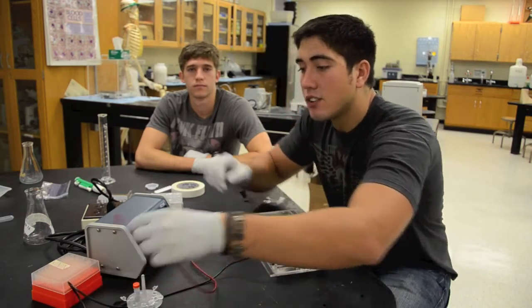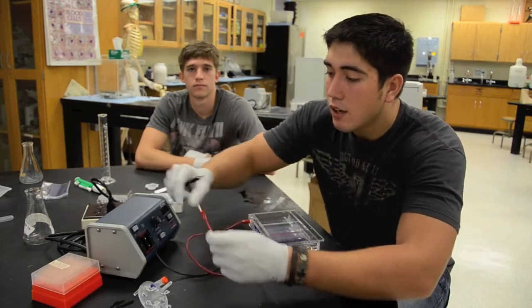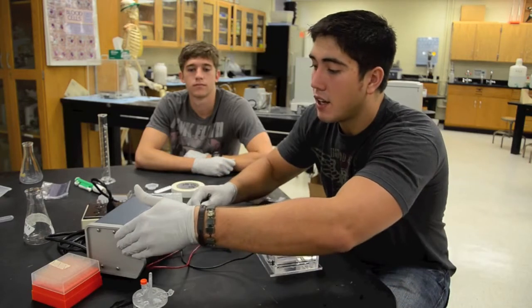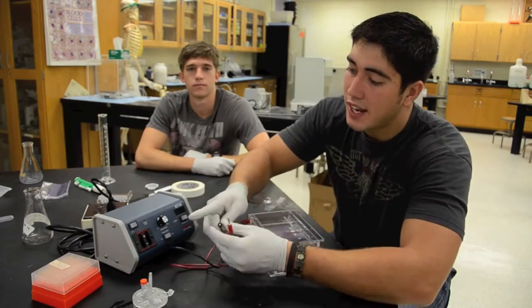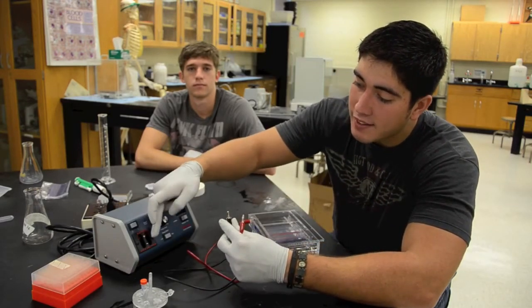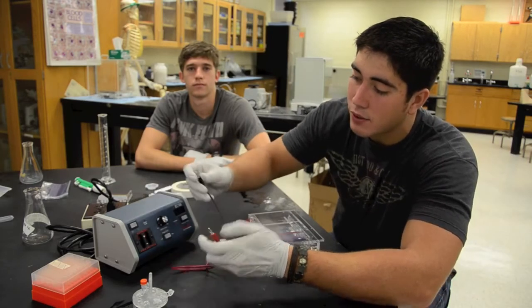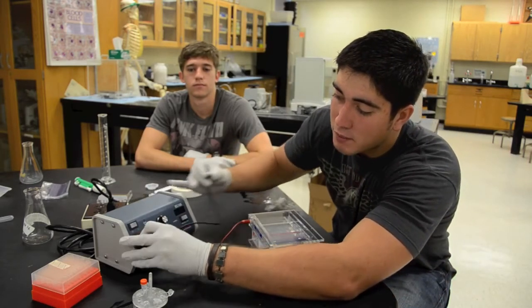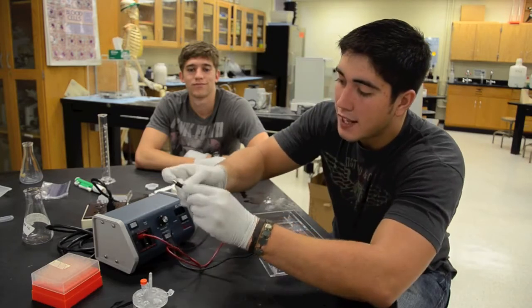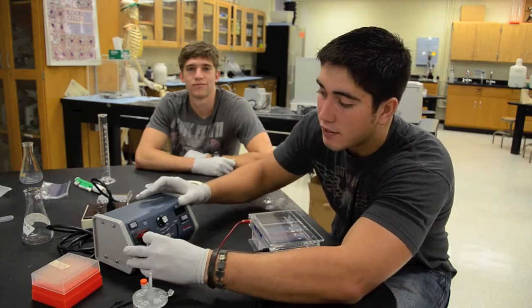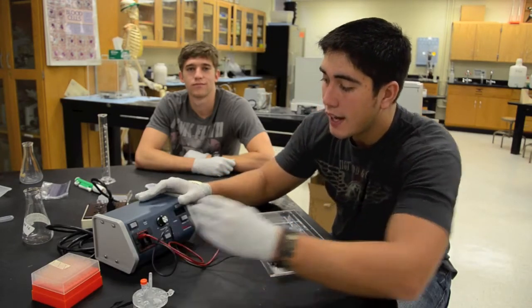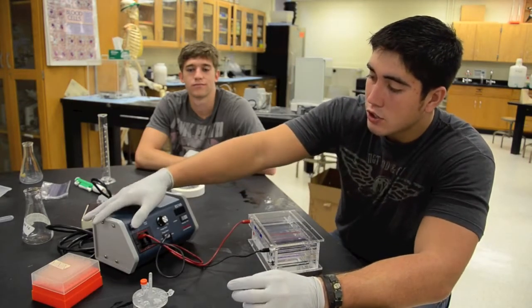Now with the other end of these you're also going to want to connect it. You're going to see on the power source that it's going to have the positive outlet and the black negative outlet. So put the red one in the red positive and the black in the negative and switch on.